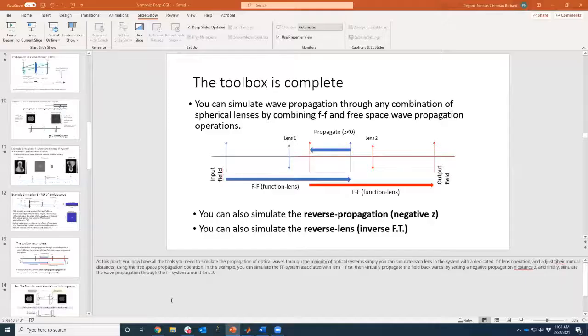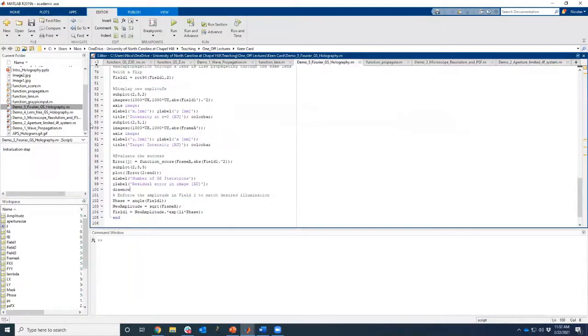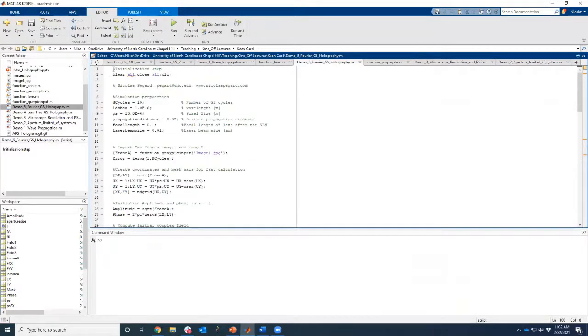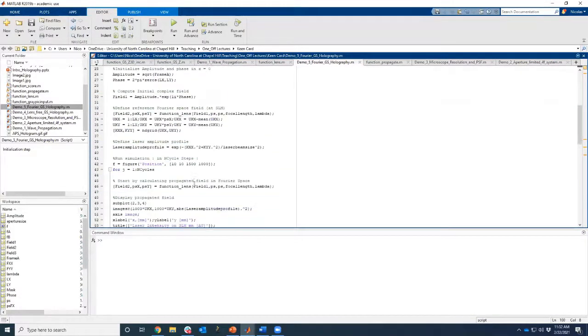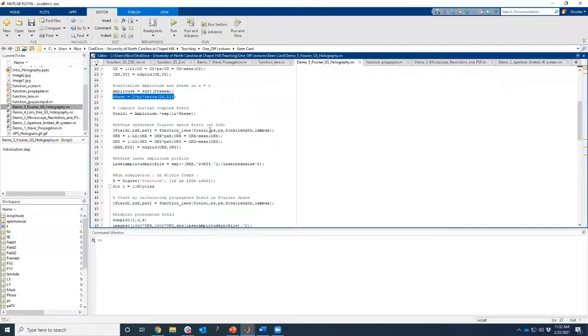So we have coded that as well. If you download the code and run this demo here, we have a similar process. So I'm going to skip the steps that are meant for display and show you the core steps. First, we initialize our beam with the amplitude that we want. And here, not a random phase, but we just set the phase to 0. You can do whatever you want. That's the initial complex field.